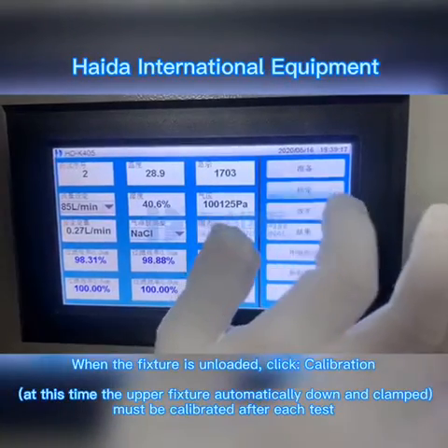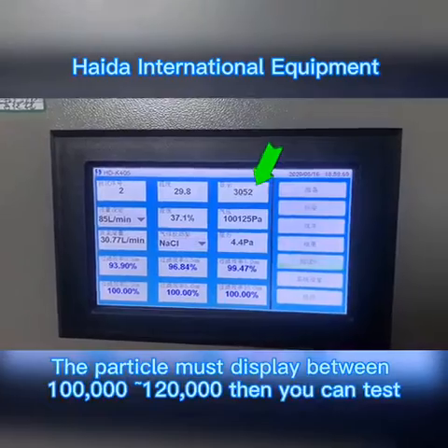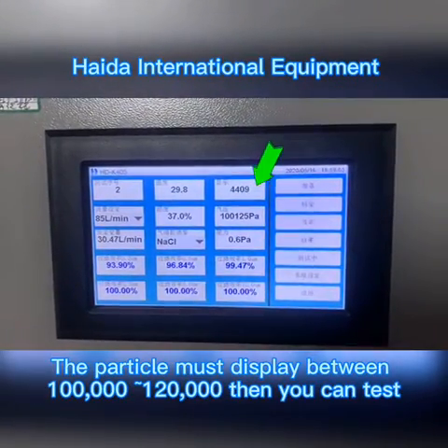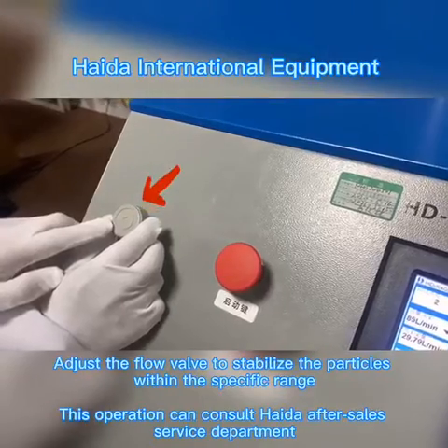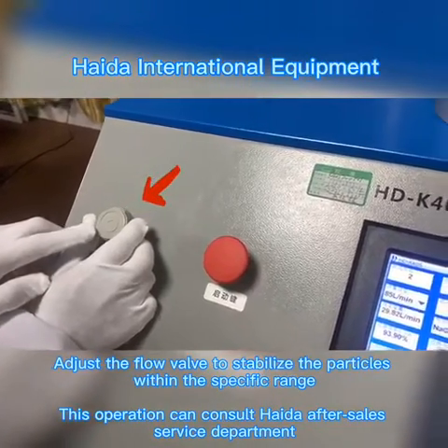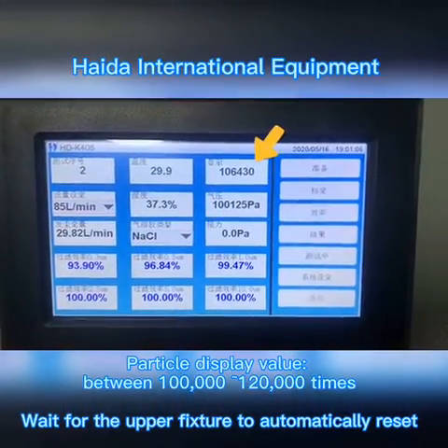When the fixture is unloaded, click calibration. The particle count must display between 100,000 to 120,000; then you can proceed to test. Adjust the flow valve to stabilize the particles within this specific range.